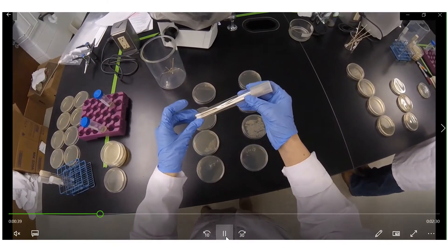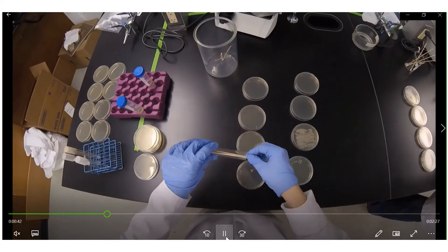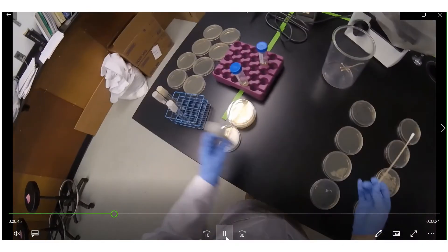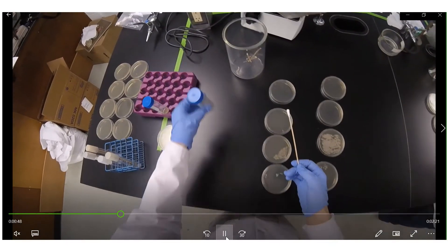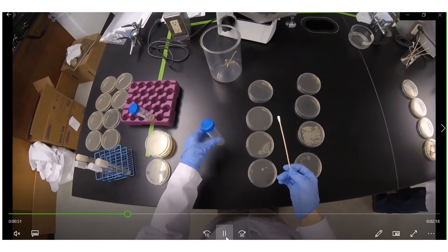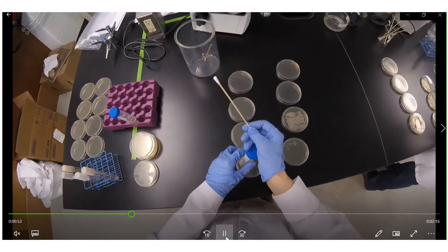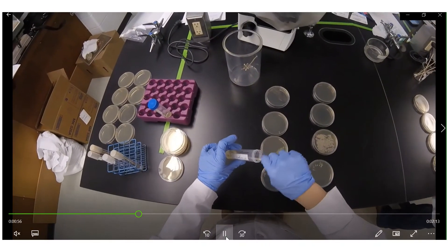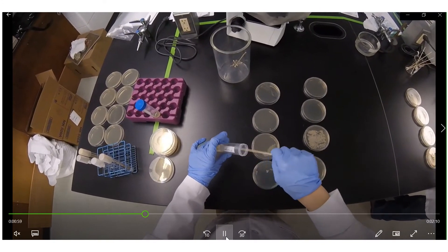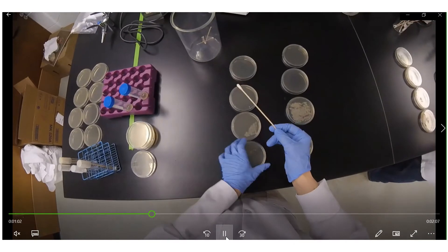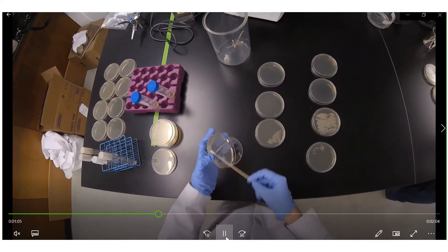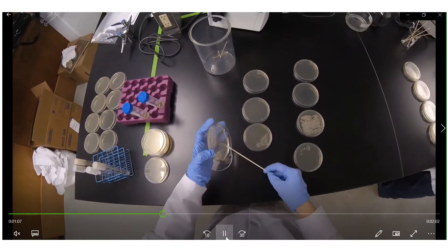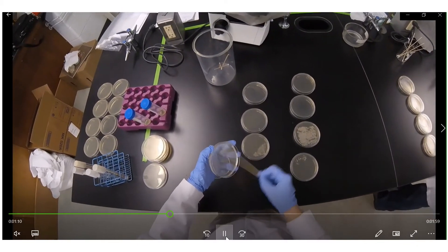Let's look at that from a different angle. So first I'm starting with a tube of sterile swabs and then I'm shaking one out and pulling that one, trying not to contaminate the rest of them. And then I shake up my TSB tube that has culture in it, give it a shake a little bit just to break apart some of that growth because you don't want to accidentally grab one cluster of microbes and then spread it on because that will defeat the purpose of making this an even lawn.